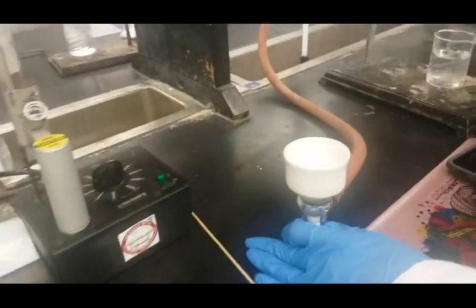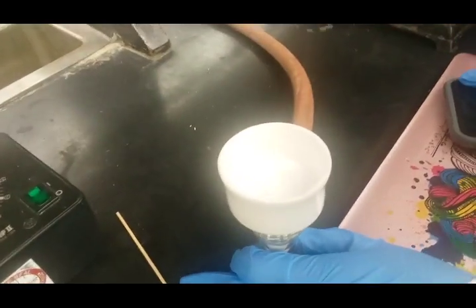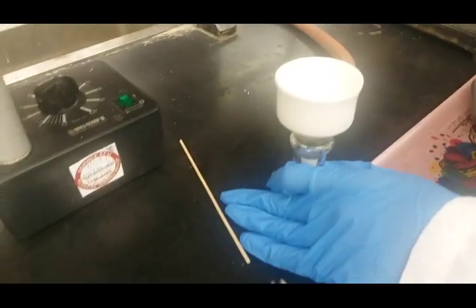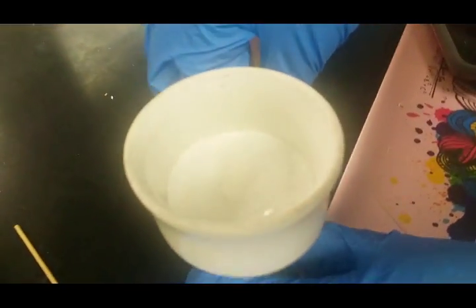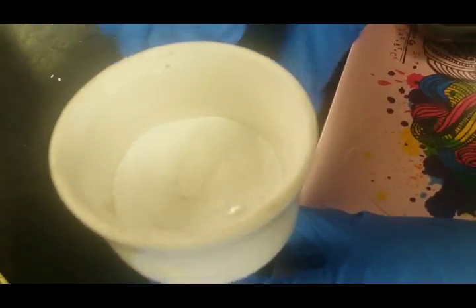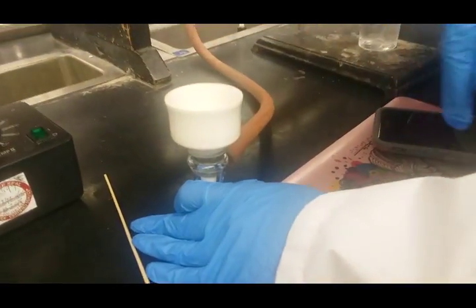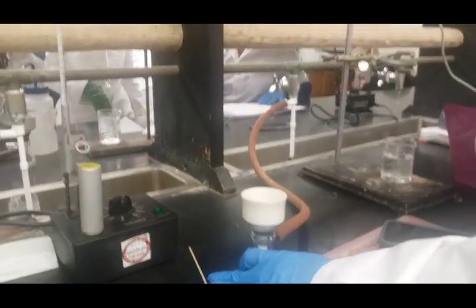Awesome, group number one. I'm looking at some crystals for the phthalic acid and it's right on the top here. Right now the vacuum is trying to dry it out, and then after it's dry, we're going to take the dry crystals and weigh it and compare it to the powder that we started with.